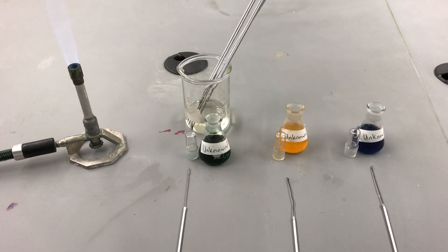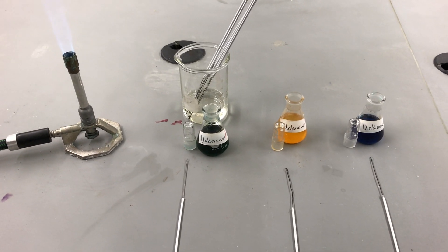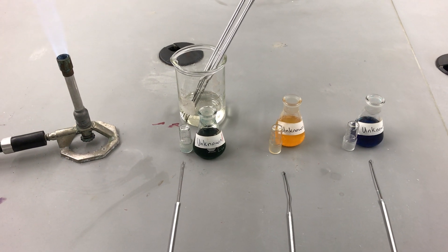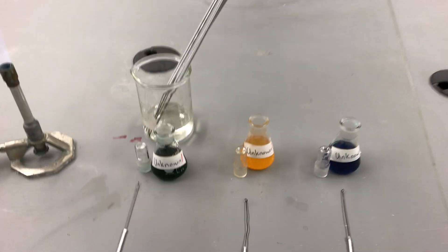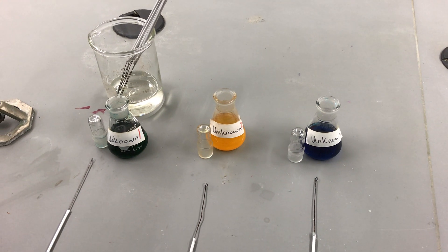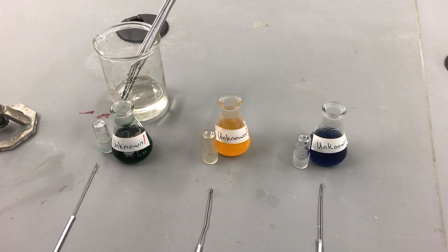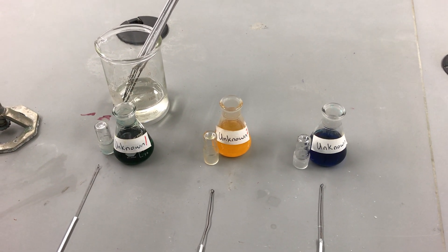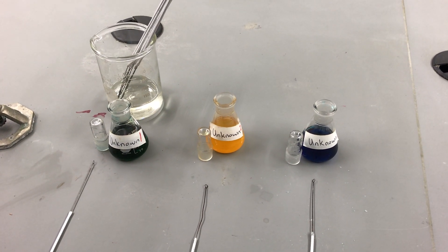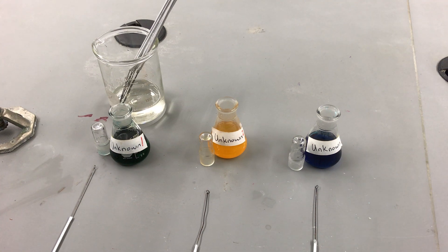All right ladies and gents, time for part two of our flame testing of inorganic evidence. Here we see our three unknown liquids and we are going to test them via flame for what color they emit, then compare them to our previously tested known substances to see which ones they're most similar to.